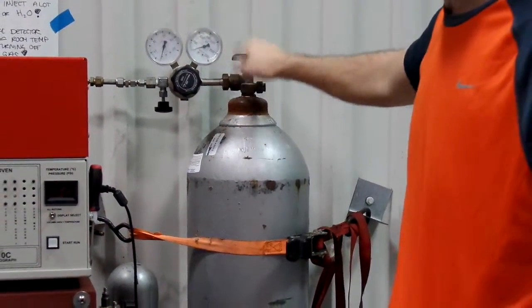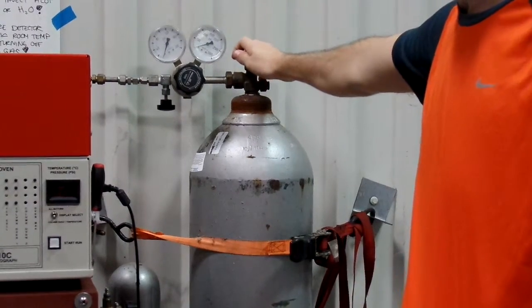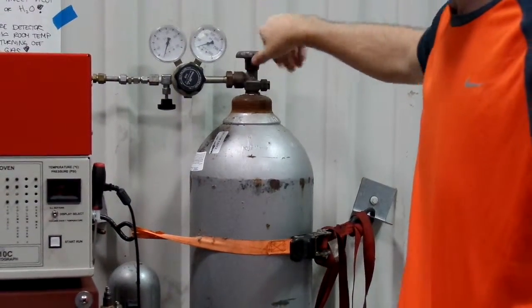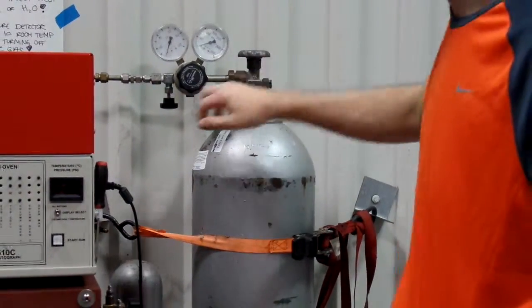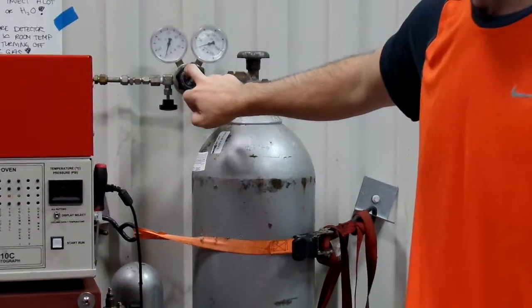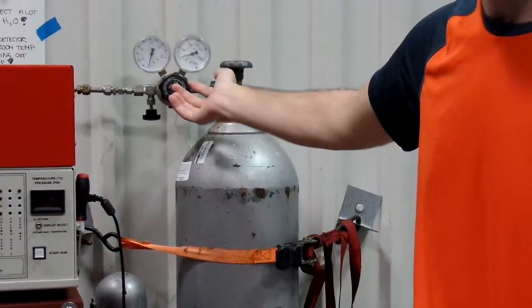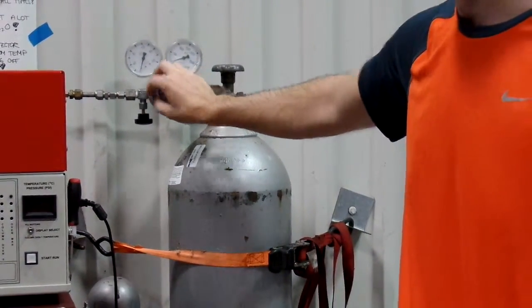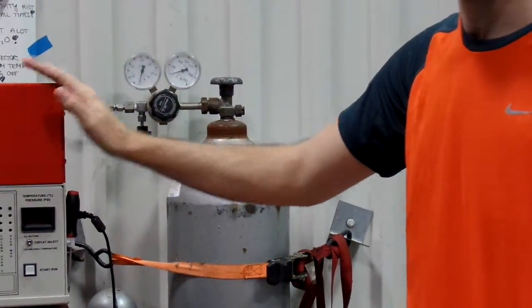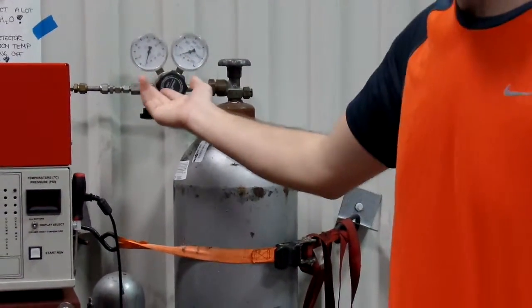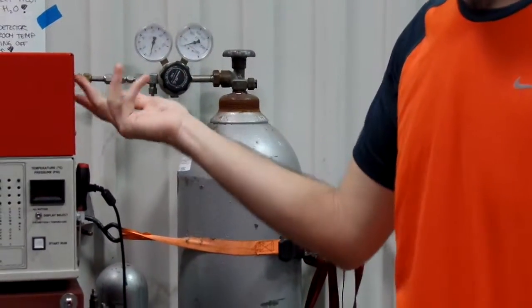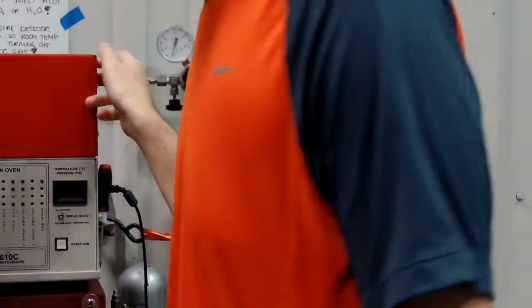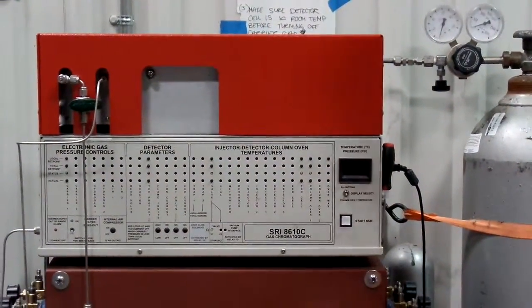So this is fully closed. When you want it to run, you just turn, open it all the way. But this stays at where it's at. This can vary. This doesn't matter. It's only set to where it's set because it's been calibrated. If we change this, we can still use it. We just have to recalibrate it. So it's no big deal. Just don't change that.